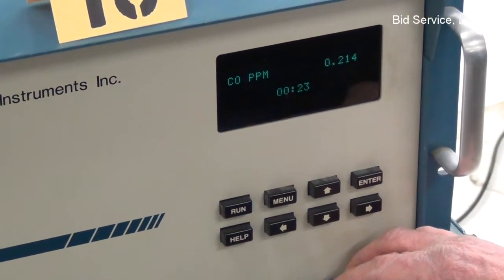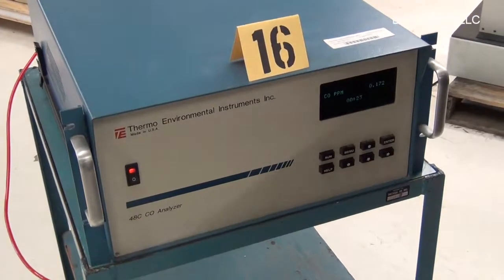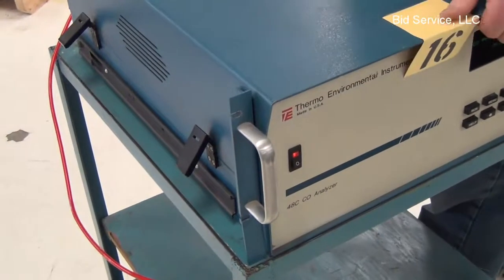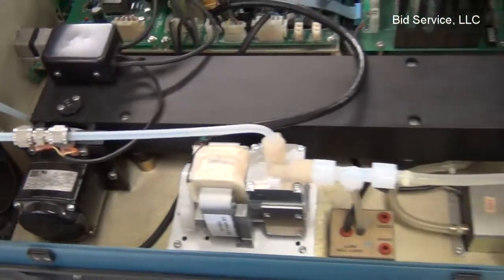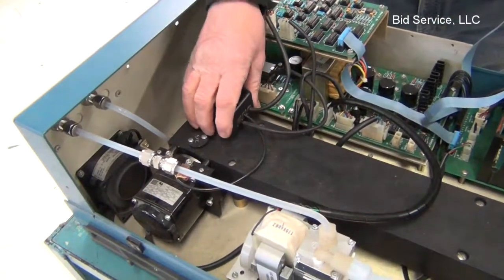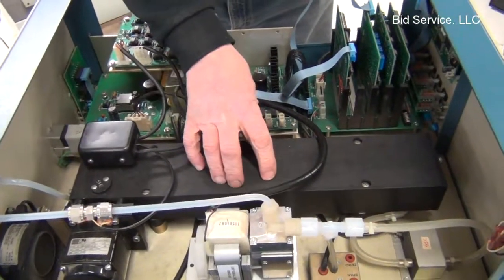Immediately it goes into the run mode, and it will start measuring any levels. Ambient air, or the sample, is brought in and goes through a series of filters. These filters are in place to take out any particles that might conflict with the optical or infrared components inside.